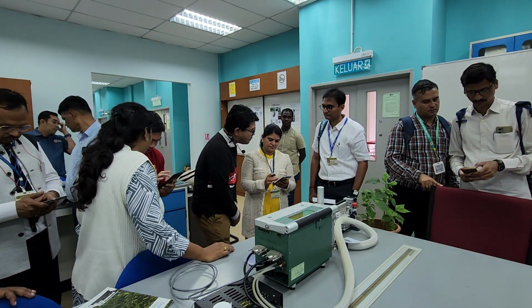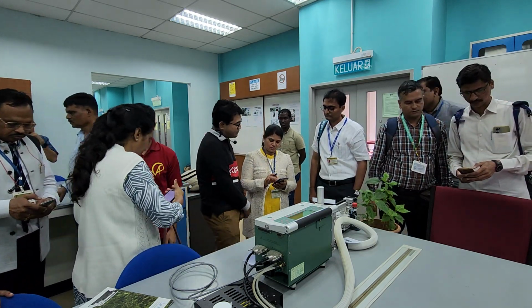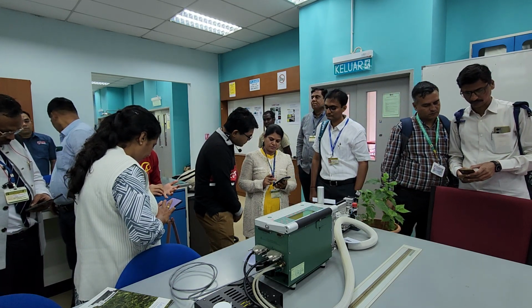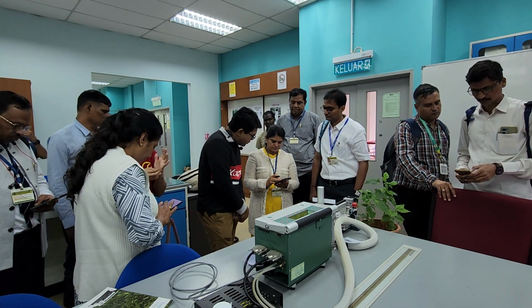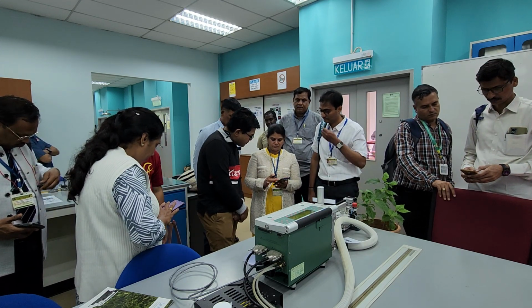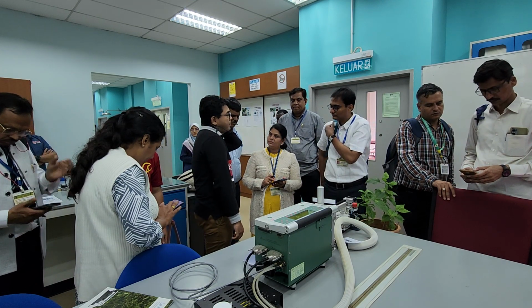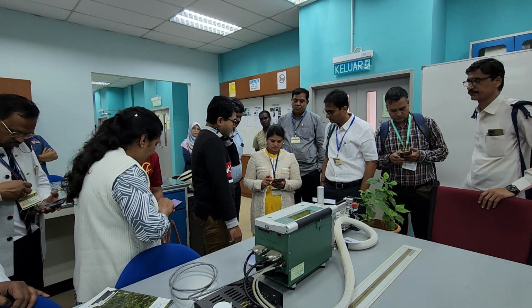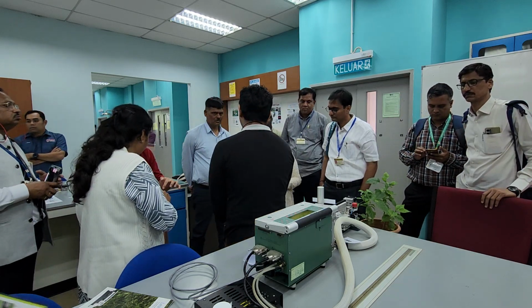That's even more impressive. Is that sorghum or millet? Sorry, sorghum. It also shows the accurate reading. That's good. How old is the sorghum? It's big. We have some institutions growing sorghum, but UPM I think just started doing this experiment. There's so many equipment for plant physiology.